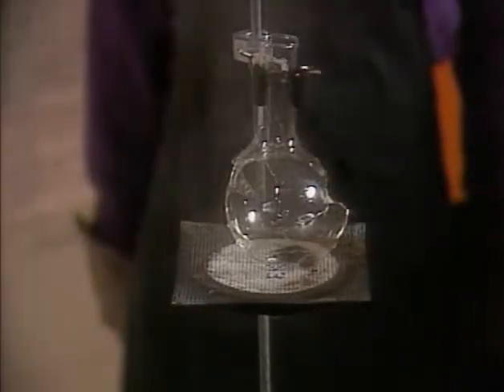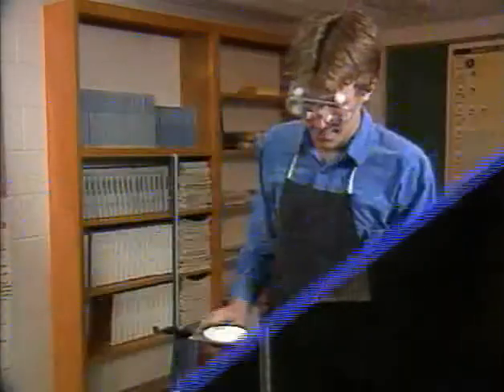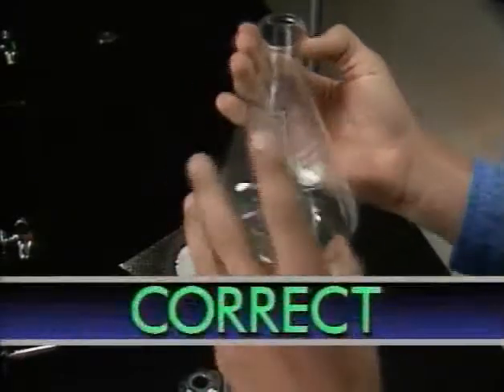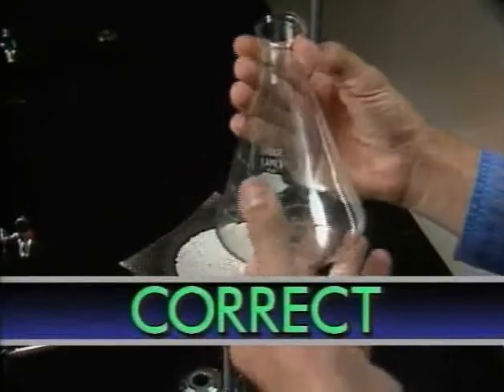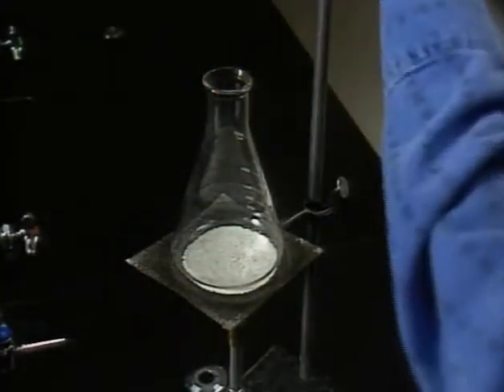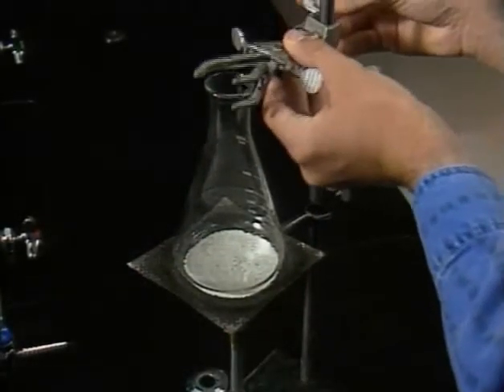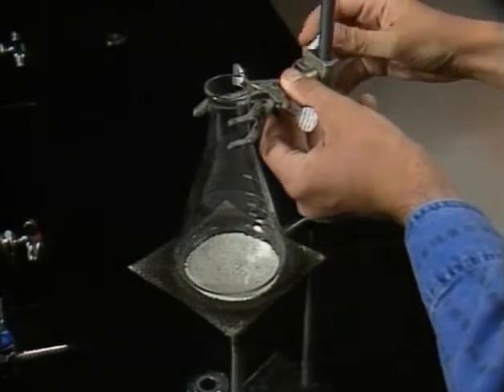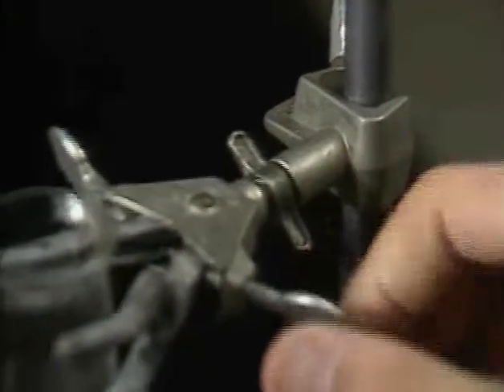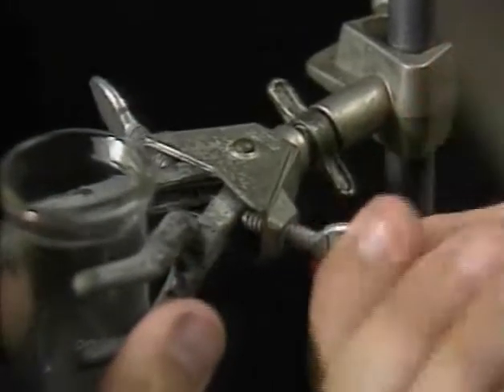Before you heat any glassware, check it carefully for cracks or stars. Flat-bottomed containers are normally heated on a wire screen on a ring stand. Erlenmeyer flasks and other narrow-necked containers should be secured to the stand with a clamp.